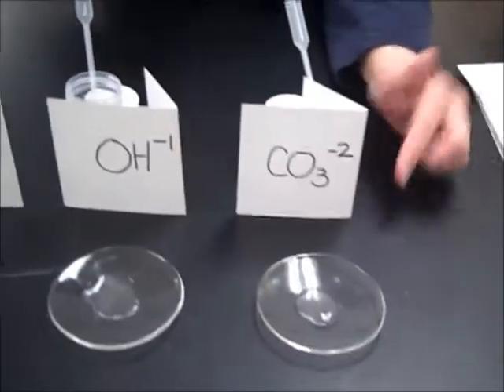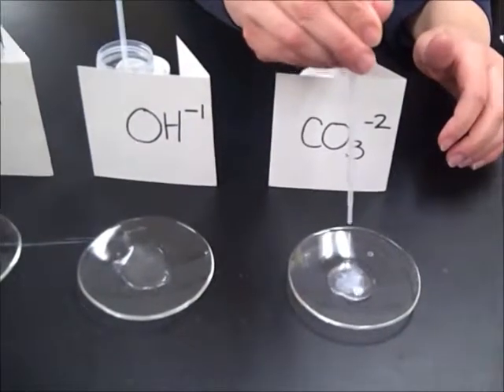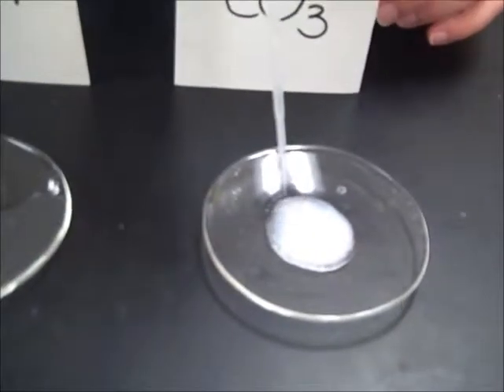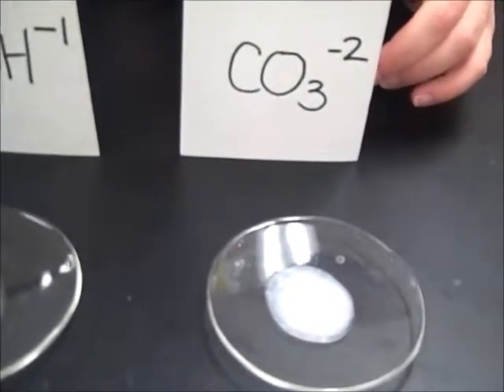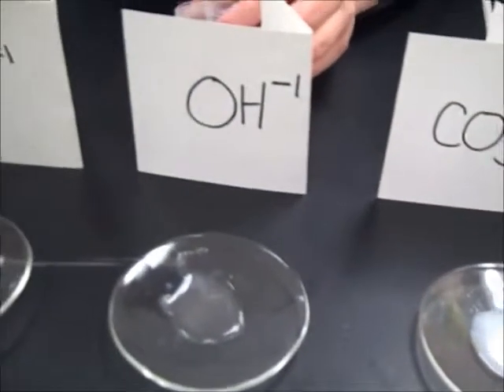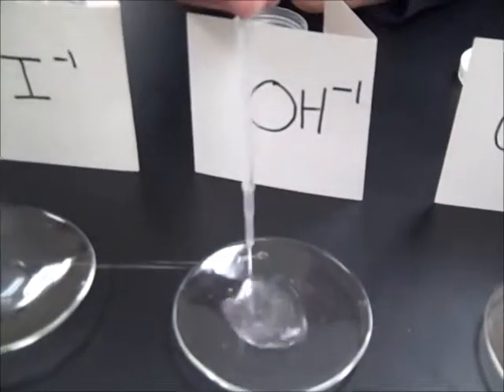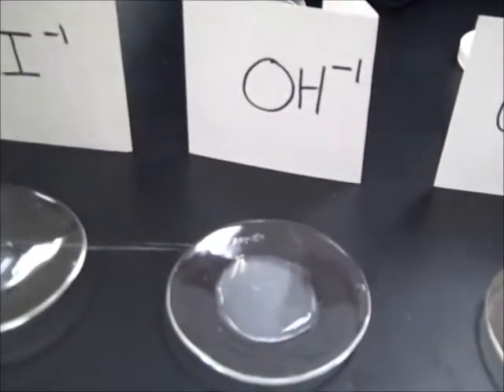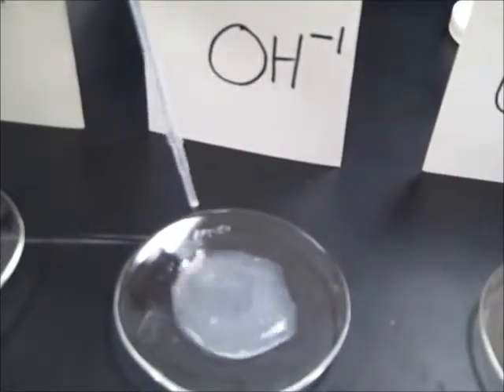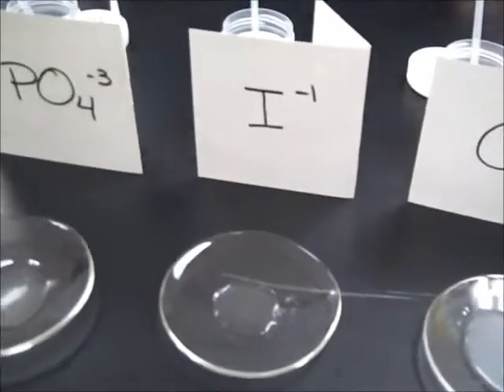We're going to look at the first one with barium and the CO3 minus 2 ion. Okay, so we have a milky substance. Looks like it's getting little grains, so we formed a solid, a precipitate in that one. This is the barium and the OH ion together. Right, definitely. It does cloud up, not as dark or not as intense.